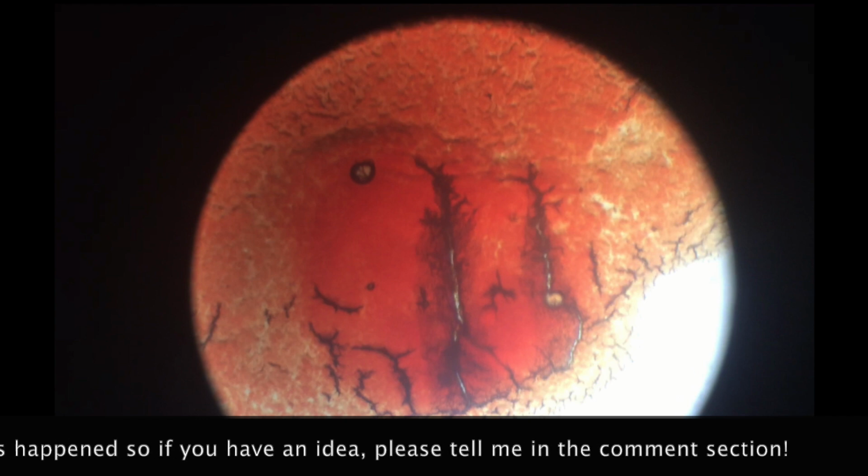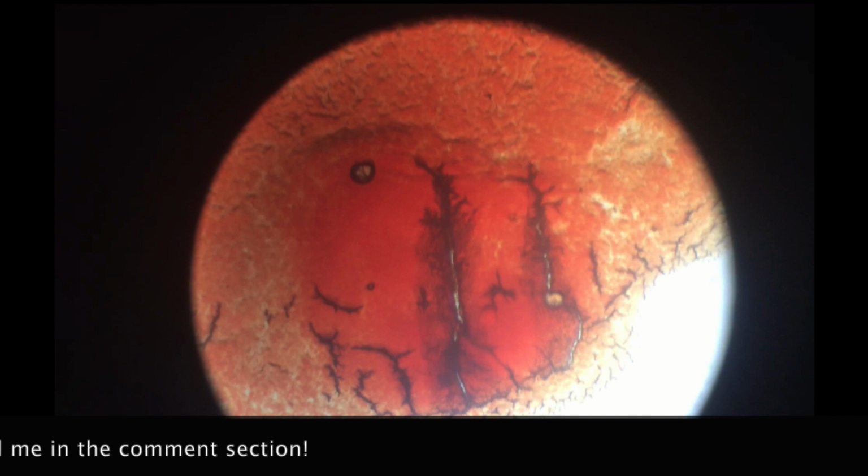I'm not an expert in this field, so if you have an idea to what happened, I would definitely appreciate if you comment it down below.